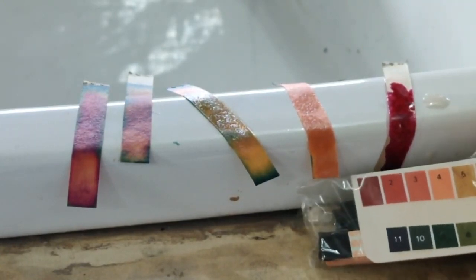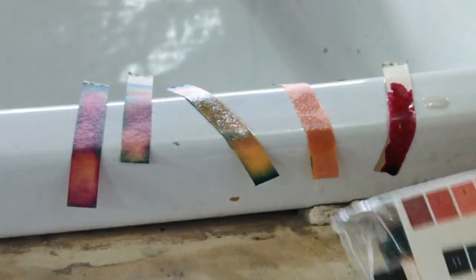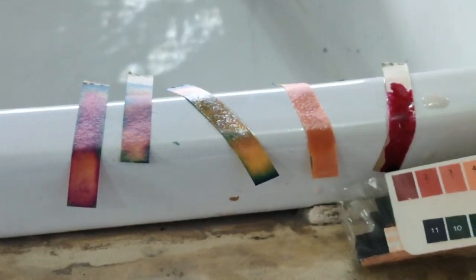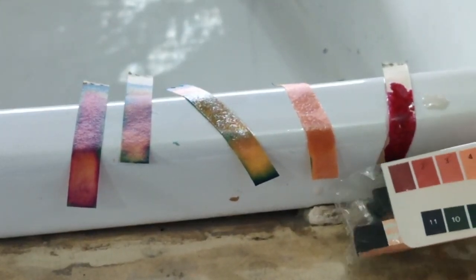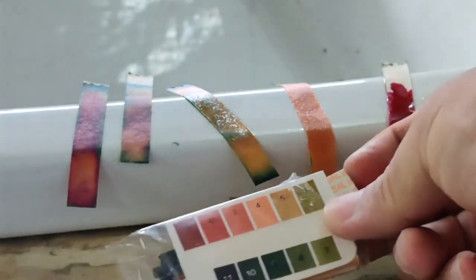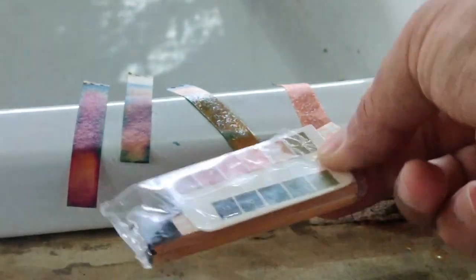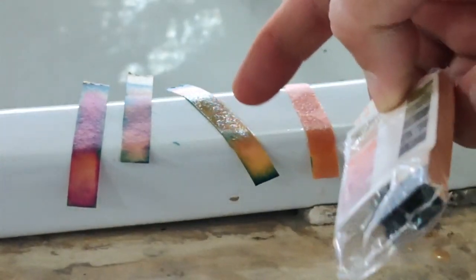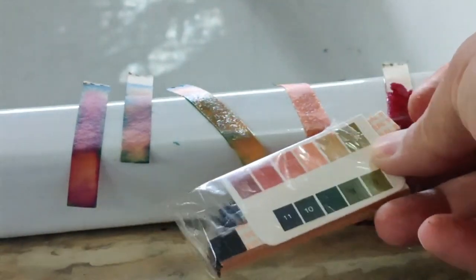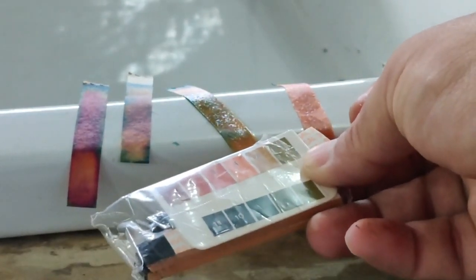So I think the strongest acid I had used was concentrated sulfuric acid. Concentrated sulfuric acid, look at this, it is matching more or less this one. So the pH value is 1, meaning very strongly acidic. This one was matching a somewhat greenish color, if you can look at this one, and somewhat if you look at that side, I think I had added acid somewhere here. So I think we should compare that color. I think it is showing something like this, 5, that is also acidic.